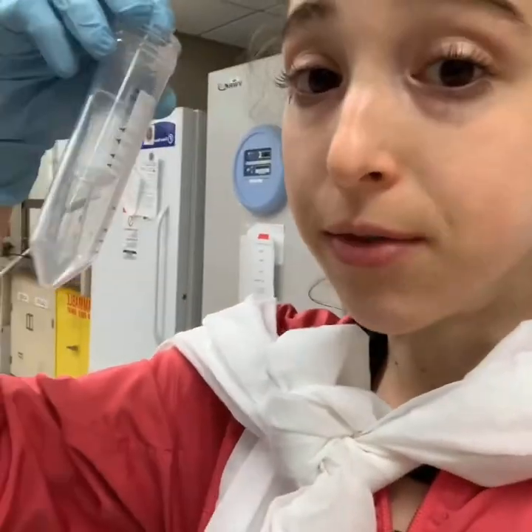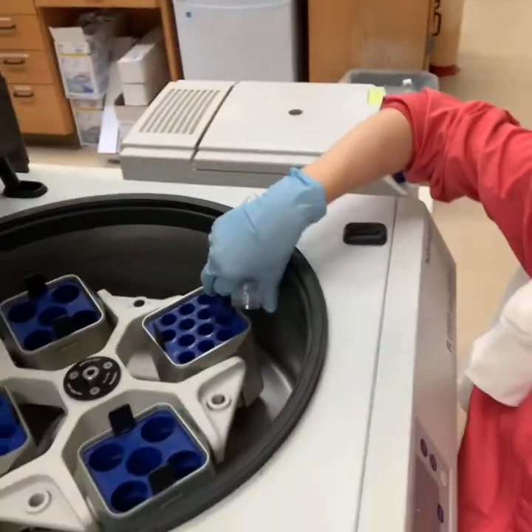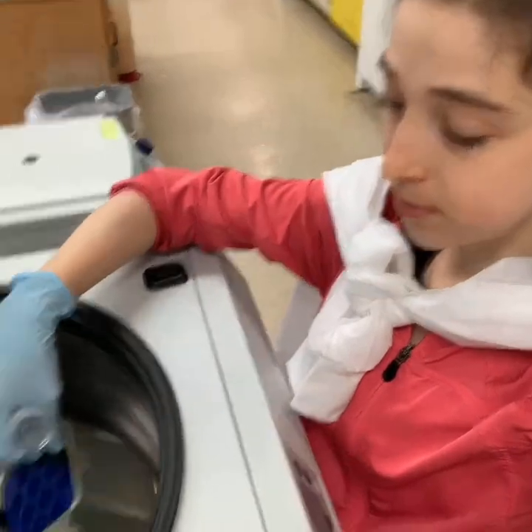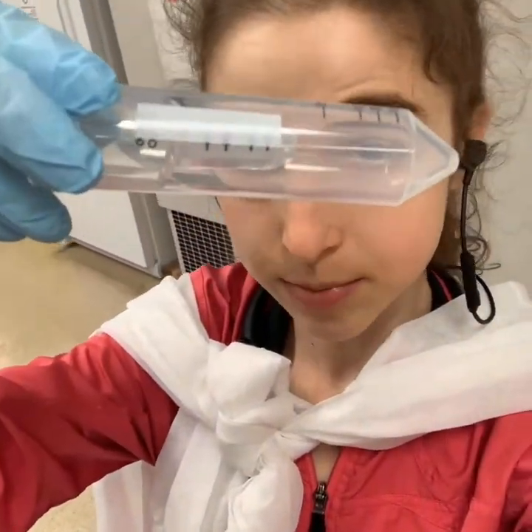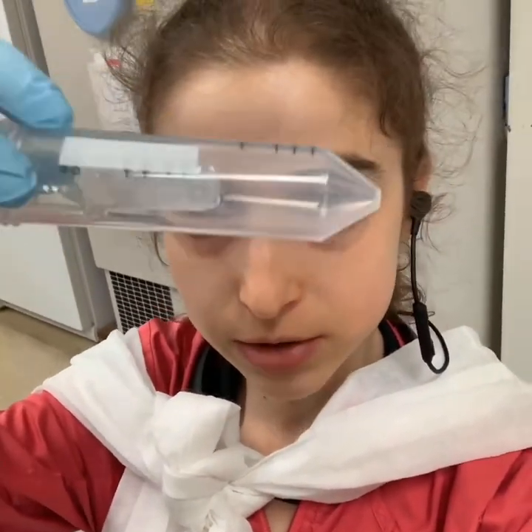You have several options when you're doing the centrifuging. One of them is what type of centrifuge you're using. This is a swinging bucket centrifuge — you can see that these buckets swing. When the centrifuge is spinning really fast, they're going to swing out, so your tube is going to go like this. This is why when you use a swinging bucket centrifuge, your sample pellet would be at the very end, in the center.